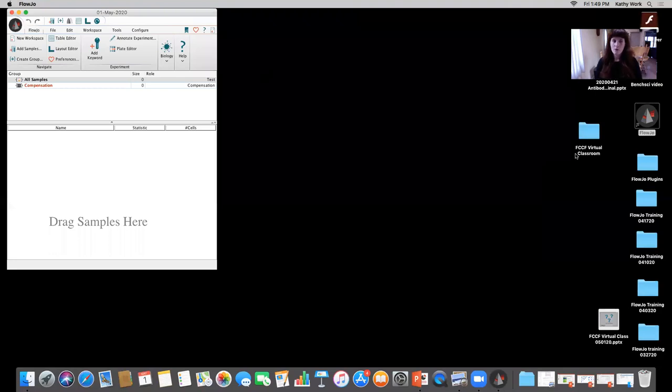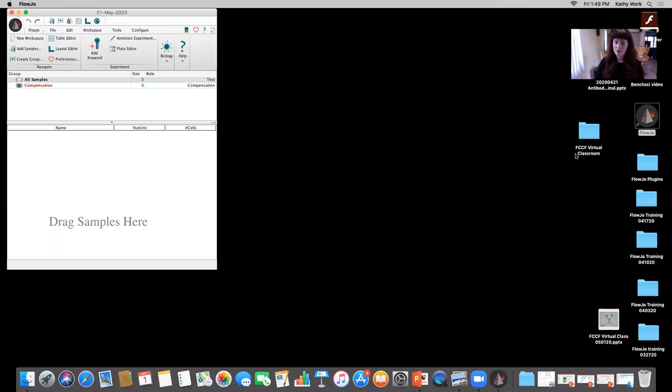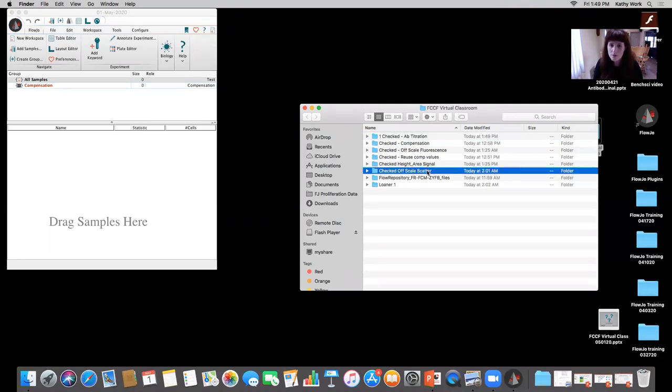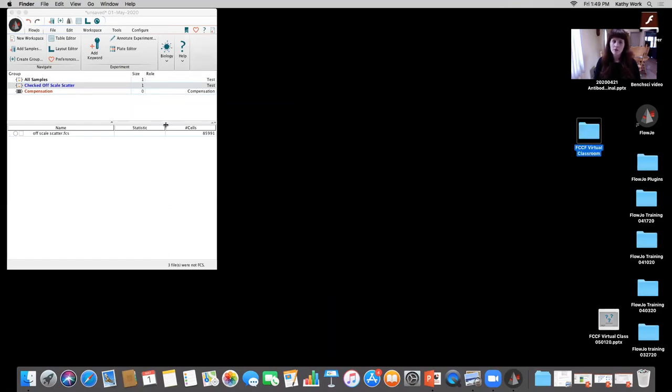So I'm going to do one more, kind of organically shift over to that discussion about debris and scatter, and then we're going to jump into some compensation. Okay. So that one is right here. I'm going to drag that in. I just want to do a very quick analysis here to show why gating is so important.